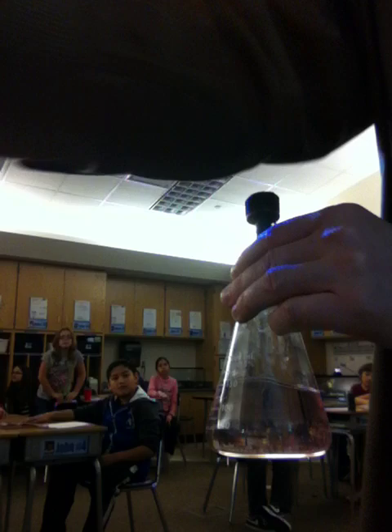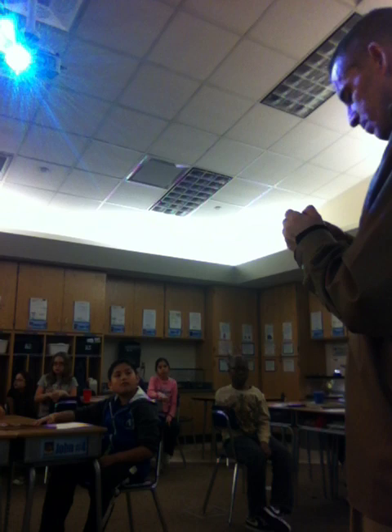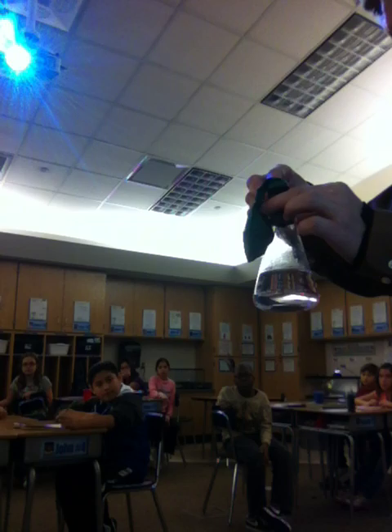I'm going to take a balloon — I've stretched this balloon out so it'll inflate easily — and stretch it over the neck of this little apparatus I rigged up. I'm going to make sure the neck opens right up over the hole on top so all the hydrogen gas is trapped inside the balloon. I want to do this quickly the minute I put my shards of zinc in here. As the zinc decomposes in this reaction, it's going to release hydrogen gas, and I want to trap that gas in my balloon to recreate the Hindenburg disaster.